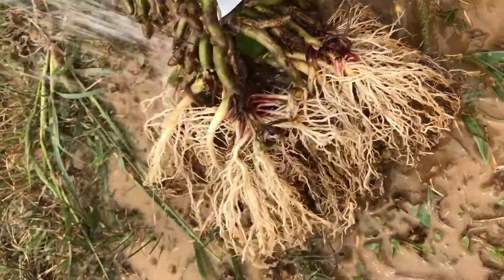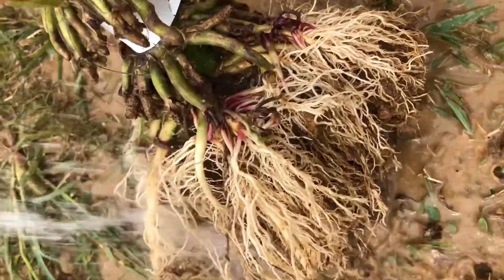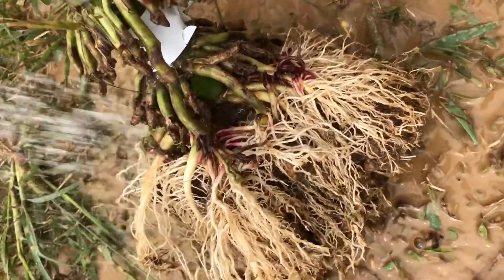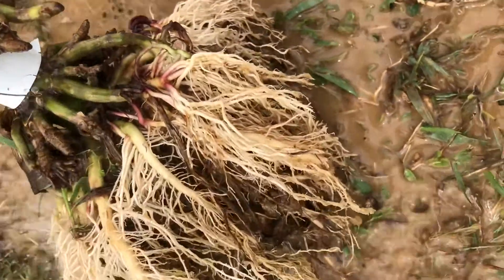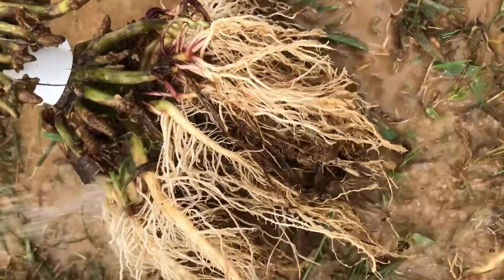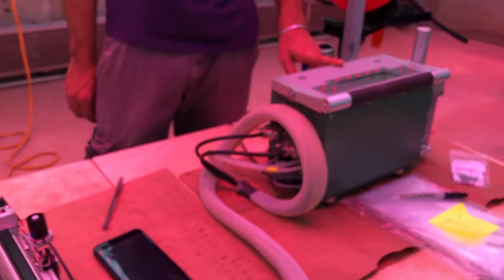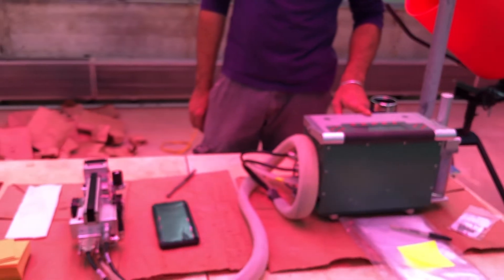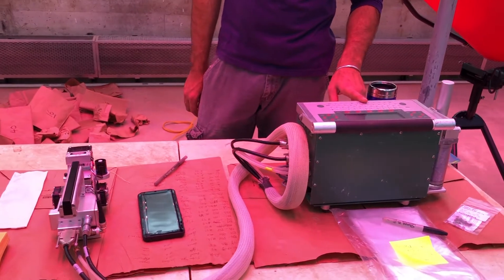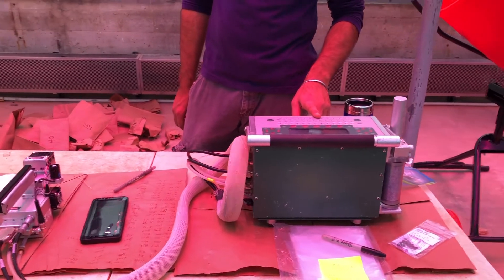The maintenance component of these costs accounts for approximately 90 percent of total respiration of the root system, and it is these maintenance costs which we are attempting to account for in this protocol. Several methods exist for measuring the respiration of root systems, but here we demonstrate just one option using the LI-COR 6400.